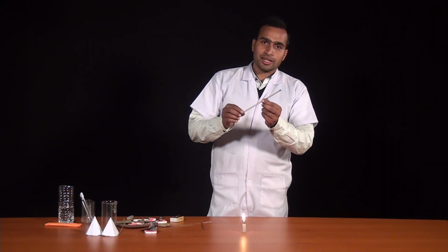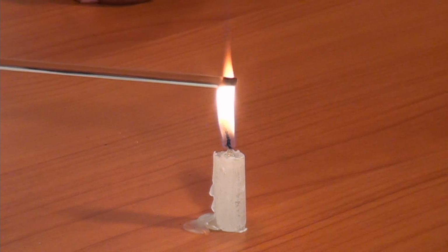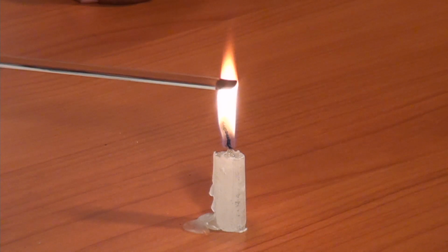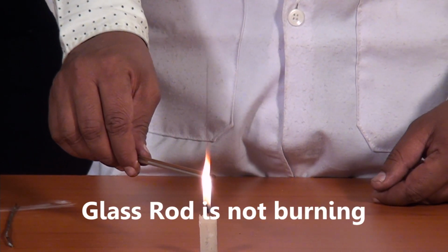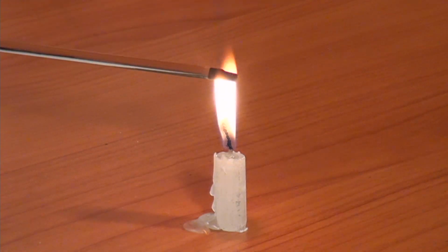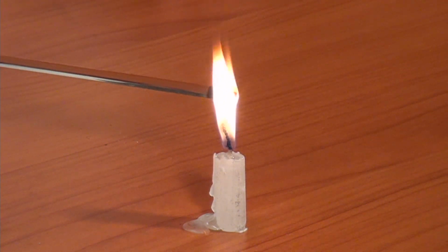This substance is a glass rod. Let's try to burn this and observe what is happening. You can see that we are trying to burn the glass rod, but it is not burning. We are trying to burn this glass rod and we can see that this is not burning.